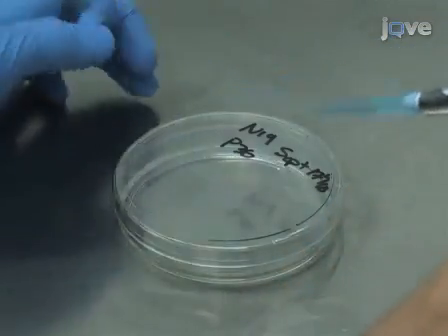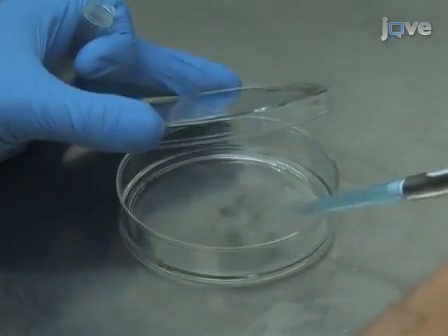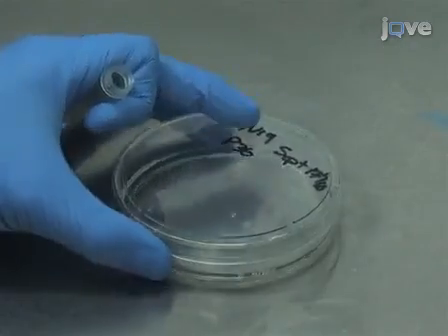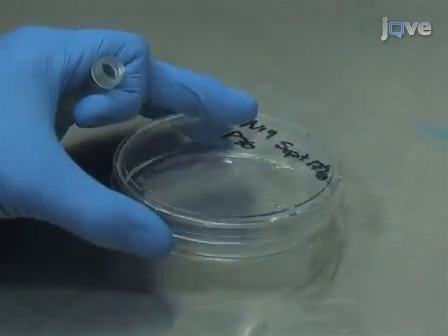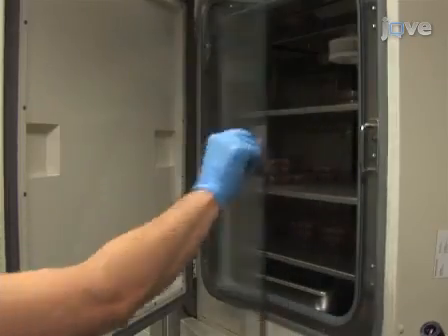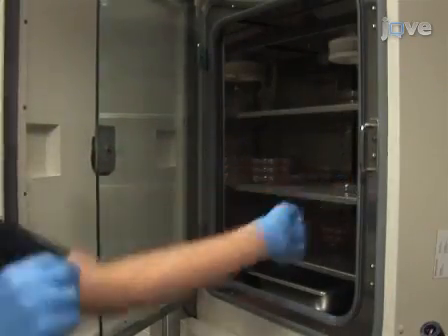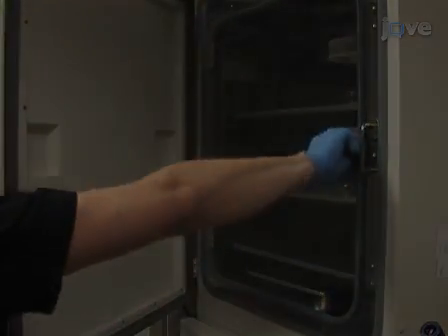Then, add the cell suspension dropwise to the plate and gently agitate the petri dish to disperse the cells evenly. Culture the cells at 34 degrees Celsius in a 5% carbon dioxide incubator for 4 hours.